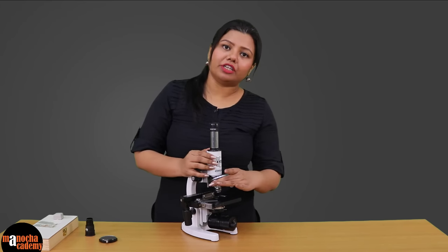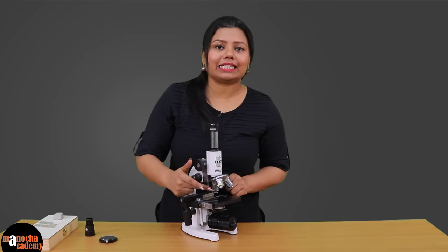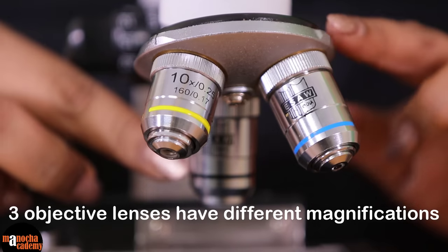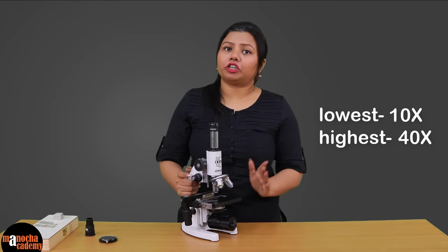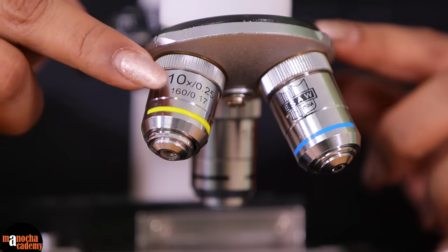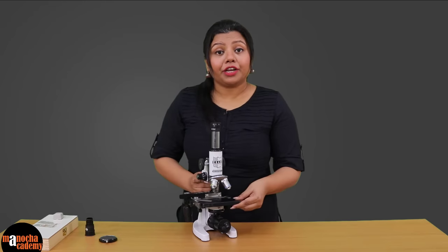At the base of the body we have this rotatable disc which is known as the nose piece. The nose piece in this microscope has three lenses attached, and these lenses are known as objective lenses. All three lenses have different degrees of magnification. The lowest power is usually 10x, and here we have three magnifications: 10x which is low power, 45x which is higher, and 100x which is the highest power in this microscope.